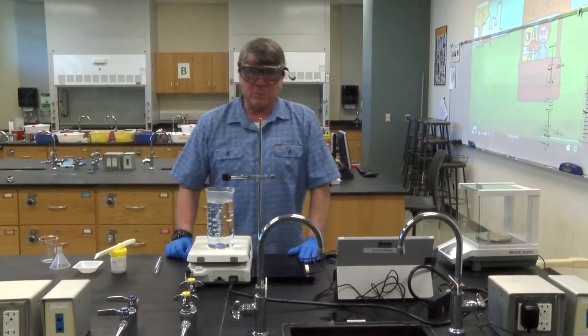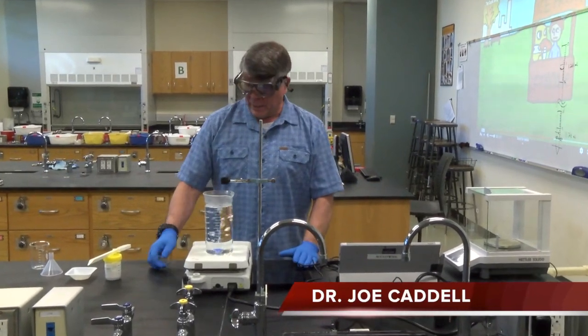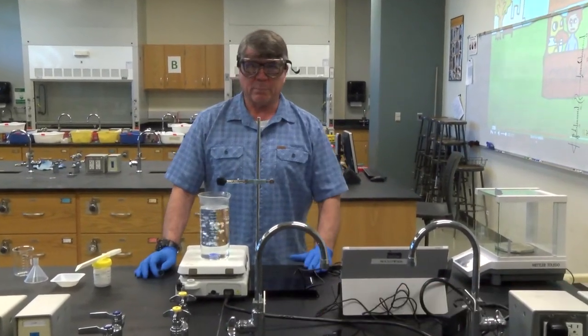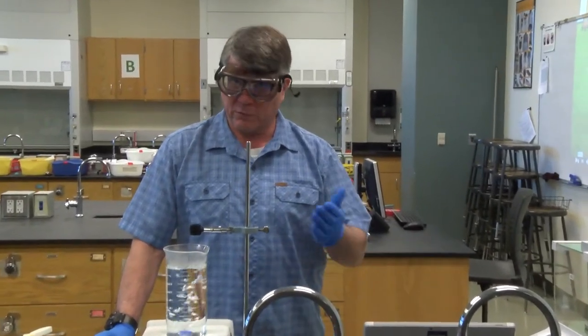Hey guys, so this is the freezing point depression lab. I'm Dr. Cadell if you don't know. The idea behind this lab is that you're going to measure the freezing point, melting point, same thing, of pure solvent. Now that solvent is at room temperature a solid, solid organic solvent.